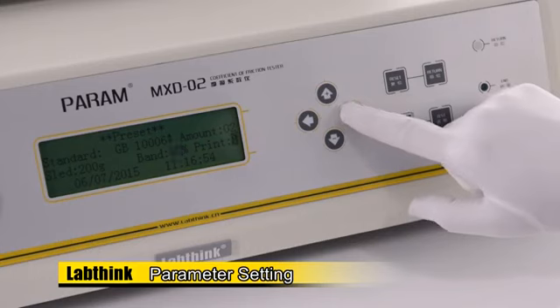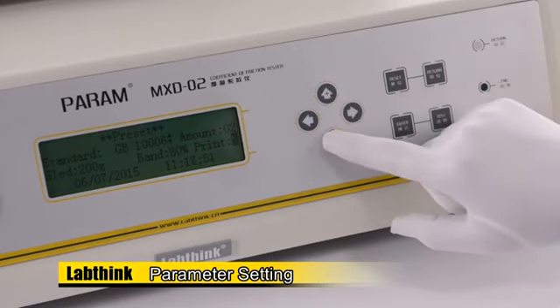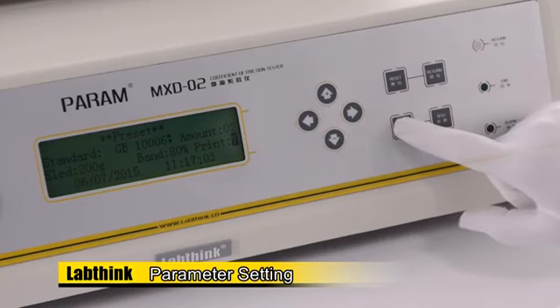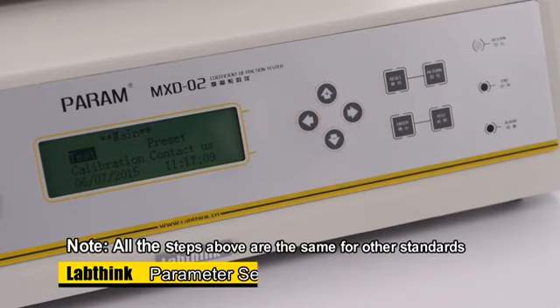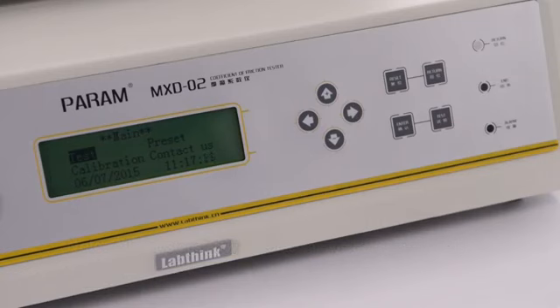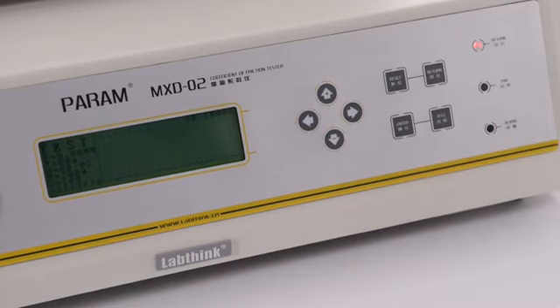Select Yes or No for the print option. Press Enter to save the setting. Press Return to exit the preset interface. Move the cursor to Test in the main interface by pressing the left or right arrow keys, and then press Enter to enter the test interface.